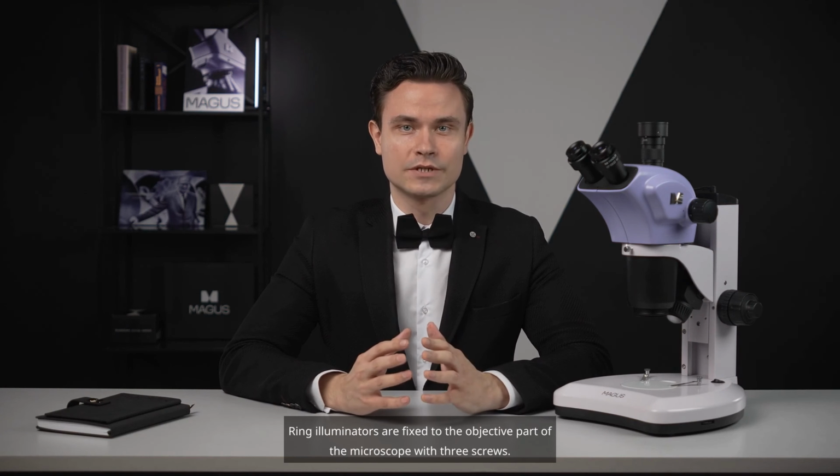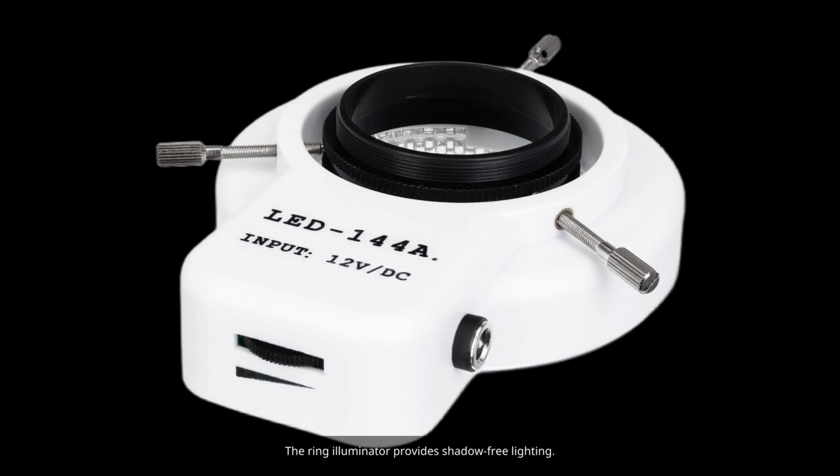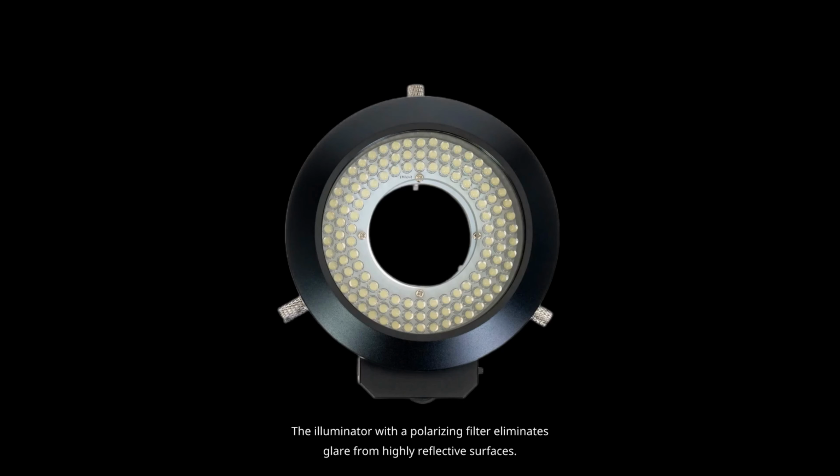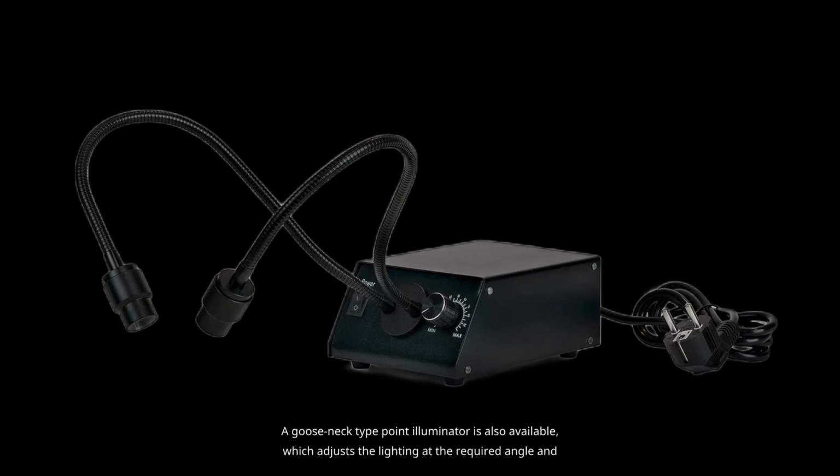Ring illuminators are fixed to the objective part of the microscope with 3 screws. The ring illuminator provides shadow-free lighting. The illuminator with a polarizing filter eliminates glare from highly reflective surfaces. The sector switching illuminator simulates oblique lighting from the desired side. A gooseneck type point illuminator is also available, which adjusts the lighting at the required angle and provides the necessary light and shadow for the study.